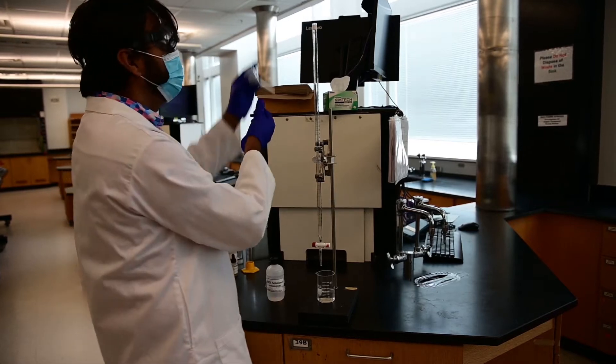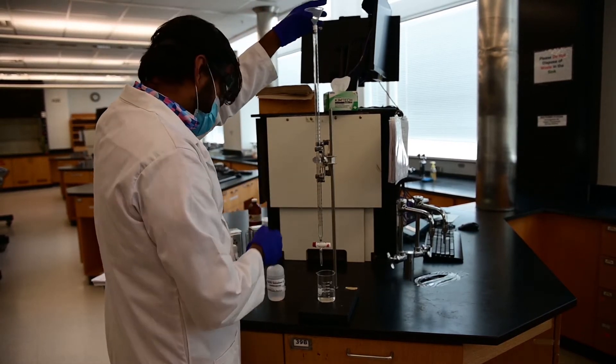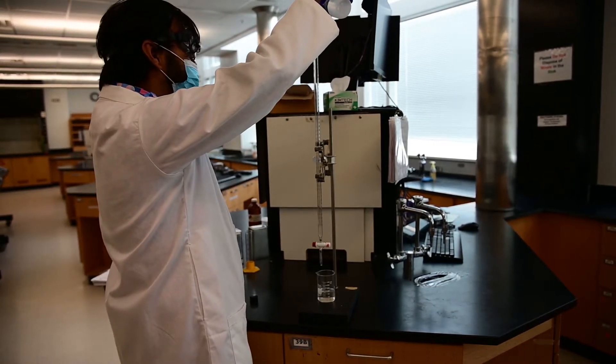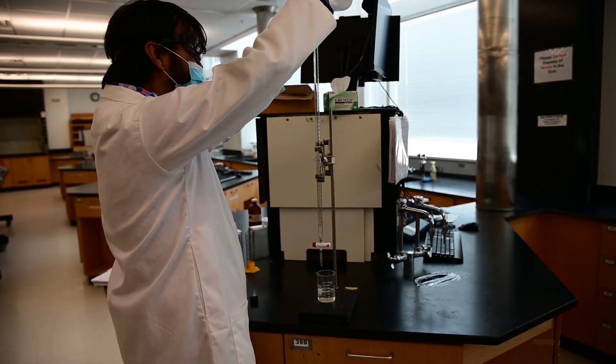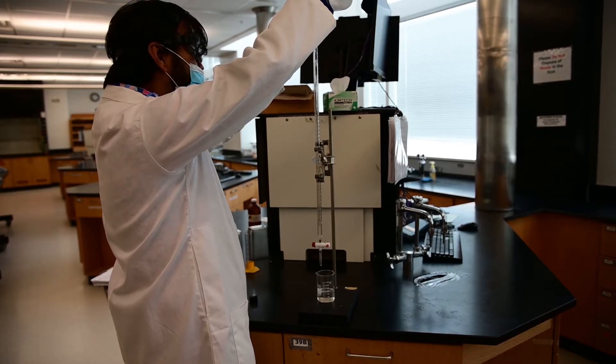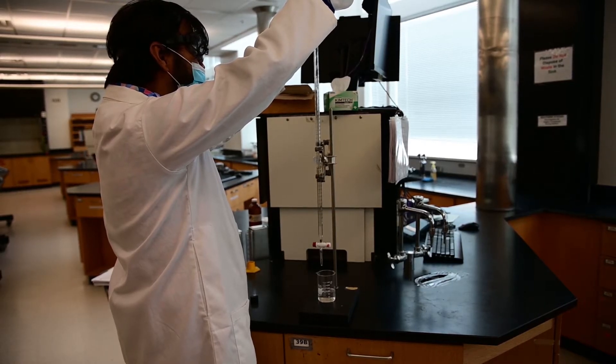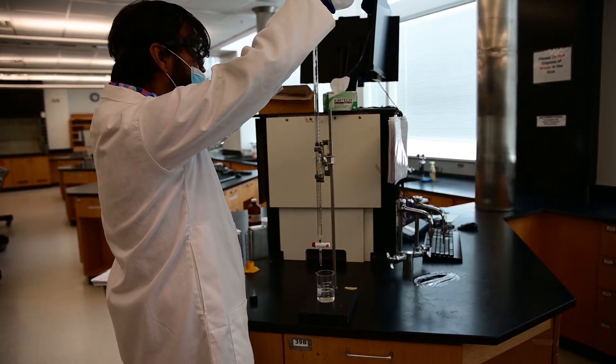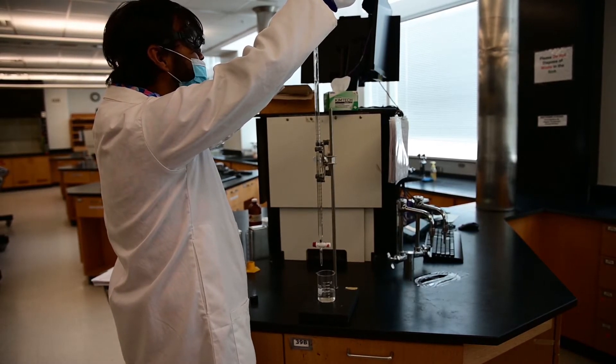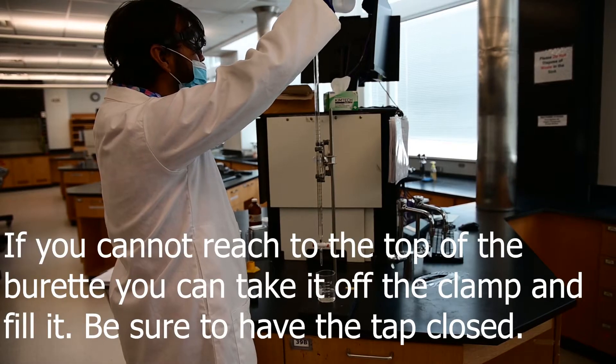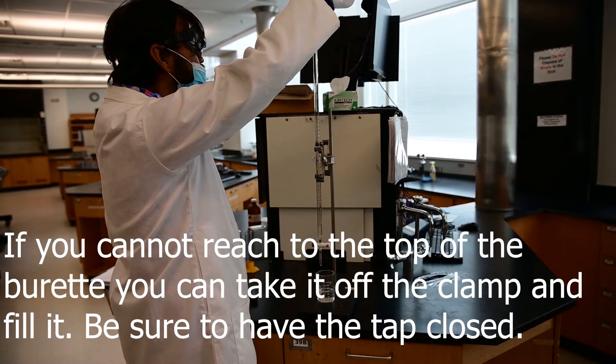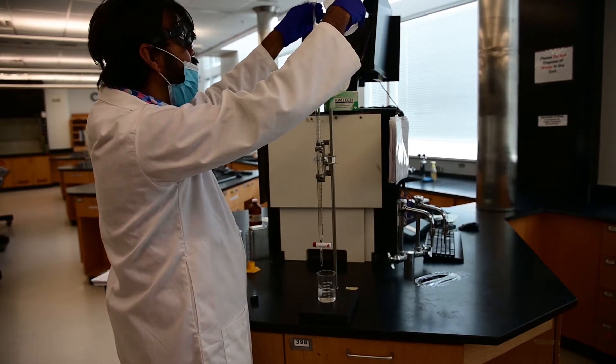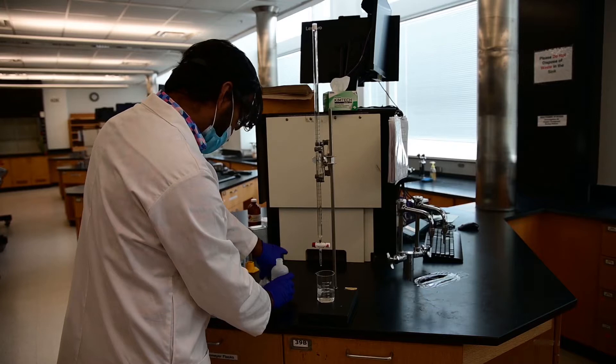Once again, put the funnel back on and then start pouring sodium hydroxide solution. This time, we will fill it completely, making sure that the tap is closed. And actually, I'm going to fill it a little above the zero mark and I'll tell you why. So make sure you're taking the funnel out.